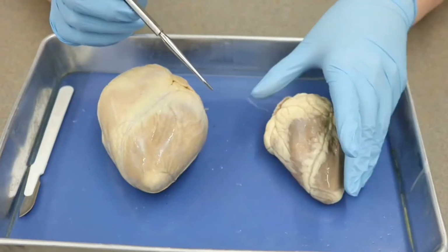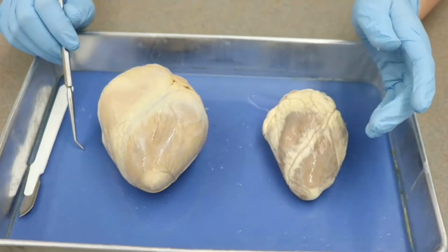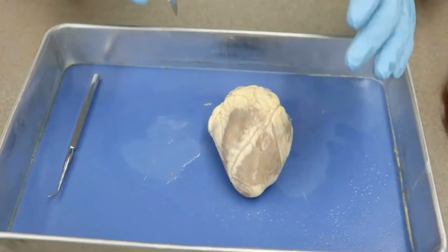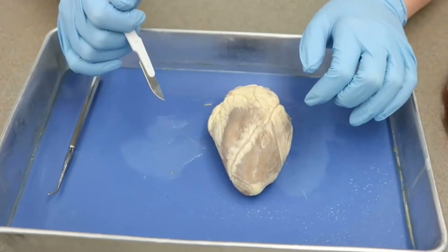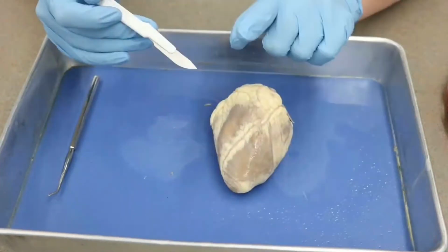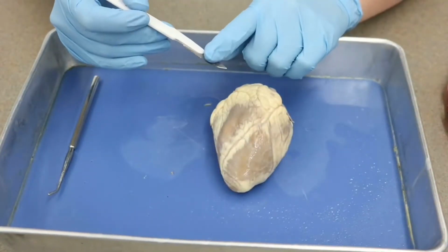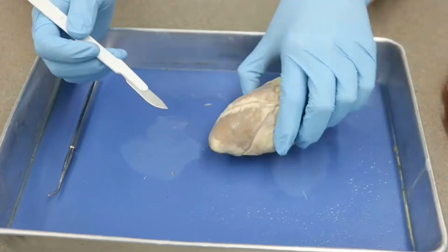So, for our external features, that is all that is on our lab sheets. We will start our dissection in just a moment. All right, guys, so now we're going to look at how to actually do the dissection of the sheep heart, which is the one you should be dissecting for yourself. So just as we have mentioned before, make sure the blade is pointed away from you, okay? You're always cutting away from yourself.